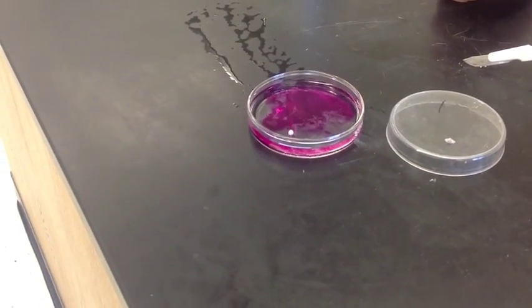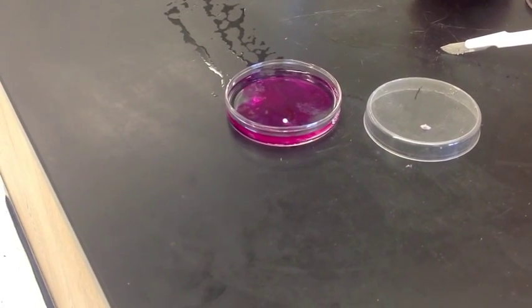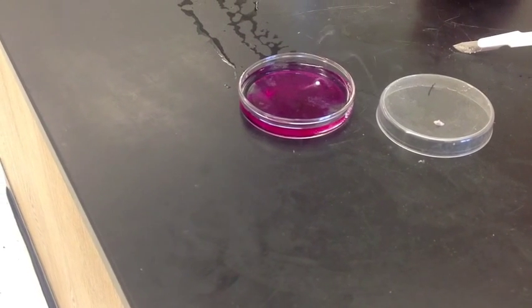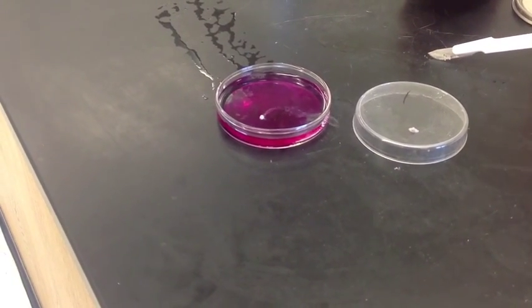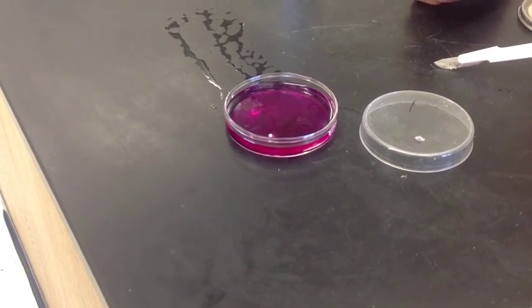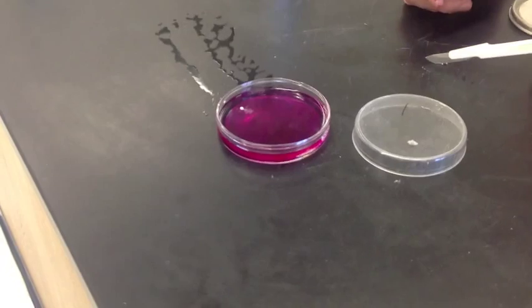And you can see it's moving around on the surface of the water. That's the hydrogen gas kind of propelling it. And we definitely see a changeover to pink. So that's a positive test for a base. And we're going to let it go until it finishes out.